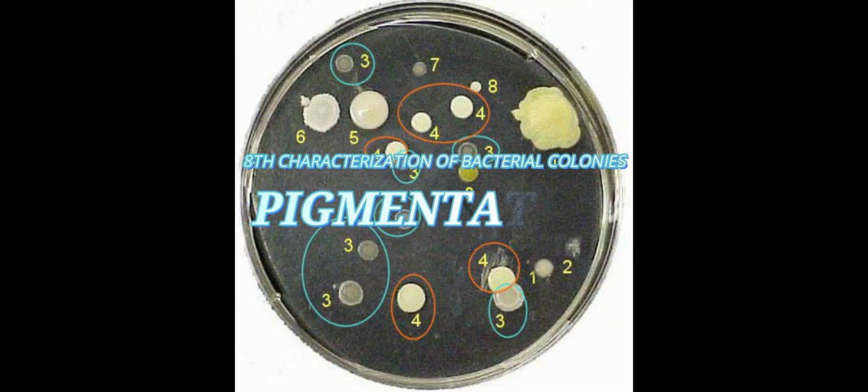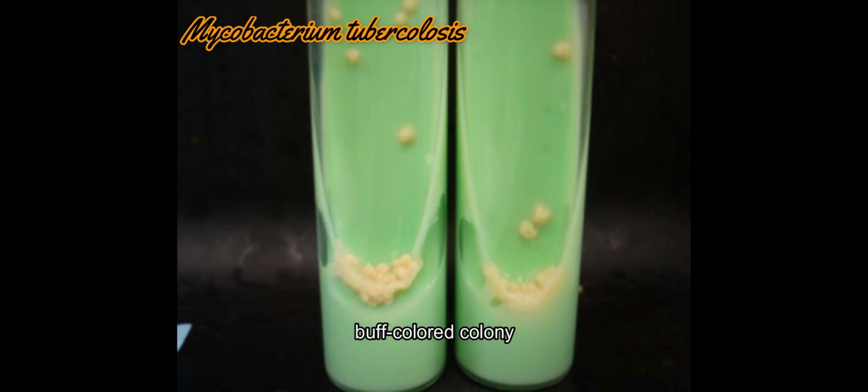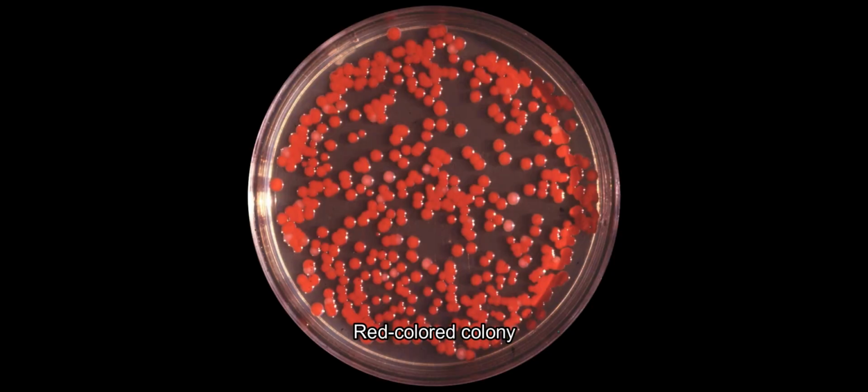The last characterization for bacterial colonies is called pigmentation. Essentially, it is how the species spreads pigment to the medium. The first one is Pseudomonas aeruginosa, which has green pigments. The next one is Mycobacterium tuberculosis, which produces a buff-colored colony. And the last one, the third one, is Serratia marcescens, which produces a red-colored colony.